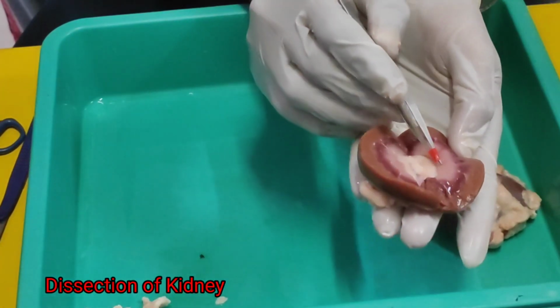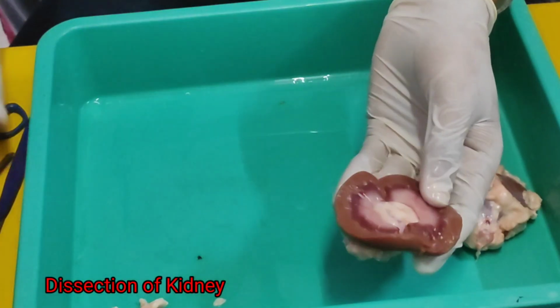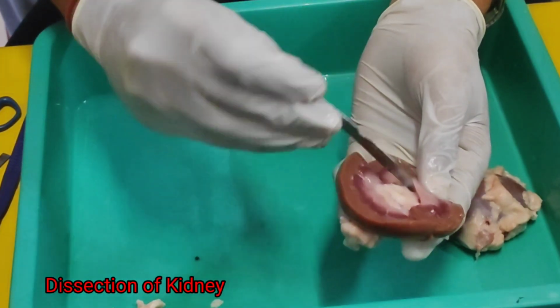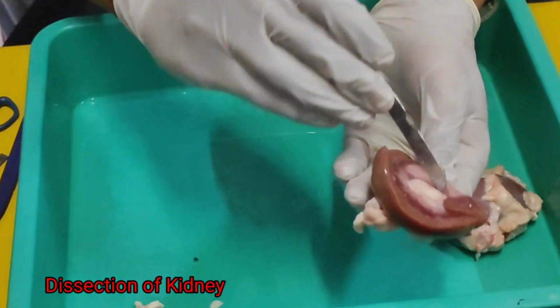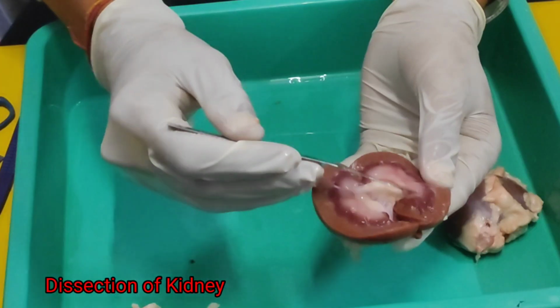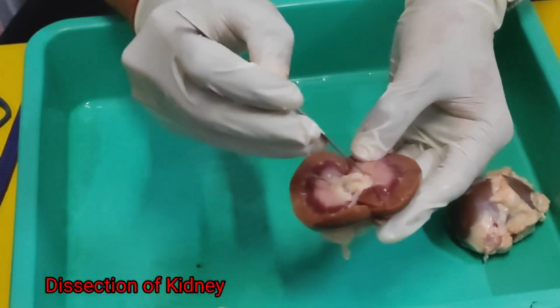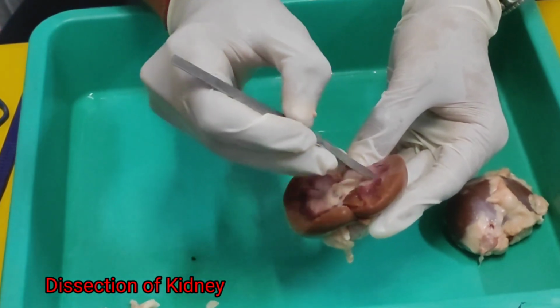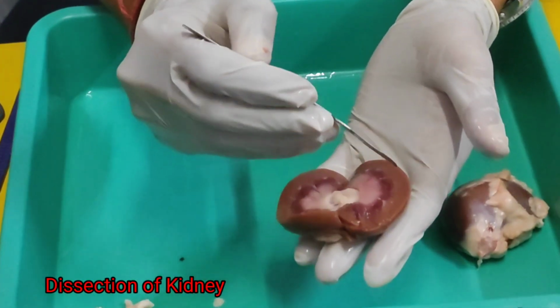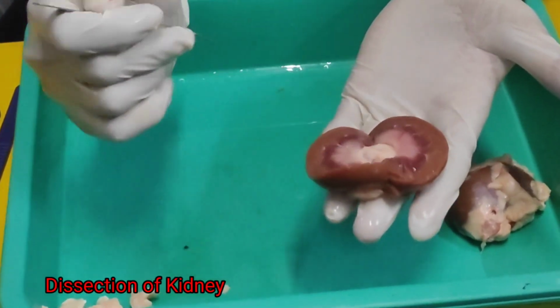When the arteries enter into the pelvis region, you'll see we have a gap over there, this gap. The renal arteries are inside the medulla, or you can say in the pelvis region. These whitish things are the pelvis region. And this pelvis is basically a region where the medulla is connected, and this cortex has millions of nephrons inside it.